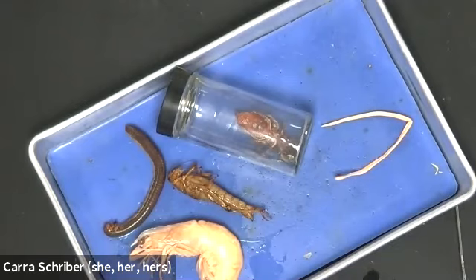So just good to compare these specimens, and I hope that that was at least somewhat helpful to you in looking at these different specimens and how visually they look really different from the outside, but also when we're looking at cross sections of each of these different organisms. So we looked at the longitudinal section of a sponge. We kind of looked at the hydra. Because it was transparent, you could kind of see the insides of it.